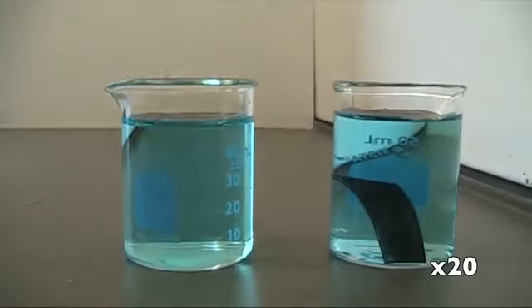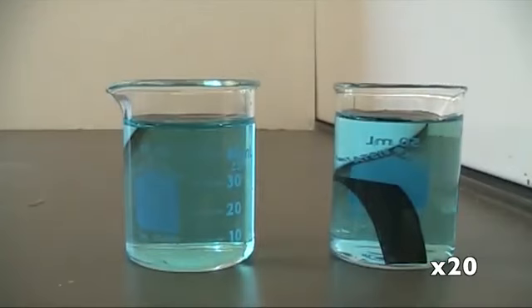For this experiment we prepared 50 milliliters of 0.1 molar copper sulfate and a strip of zinc metal. As you can see, two solutions of copper sulfate were made, one as the control, the other as the experimental, to observe any differences to the solutions after zinc was added.